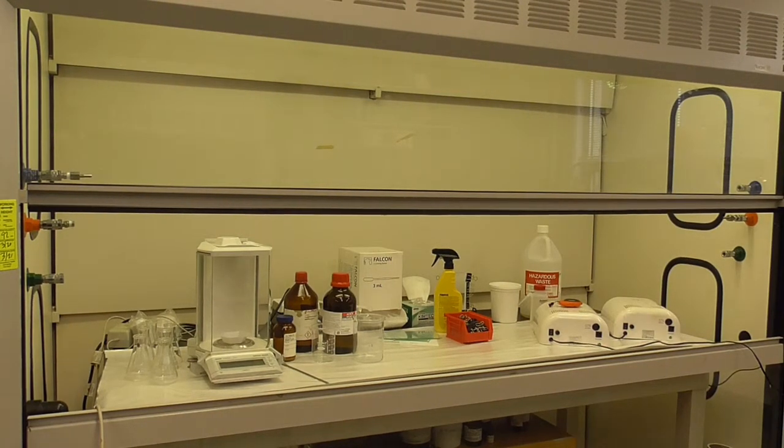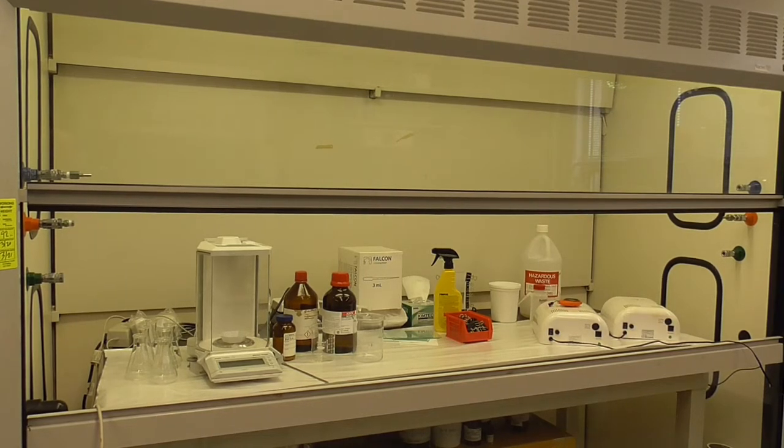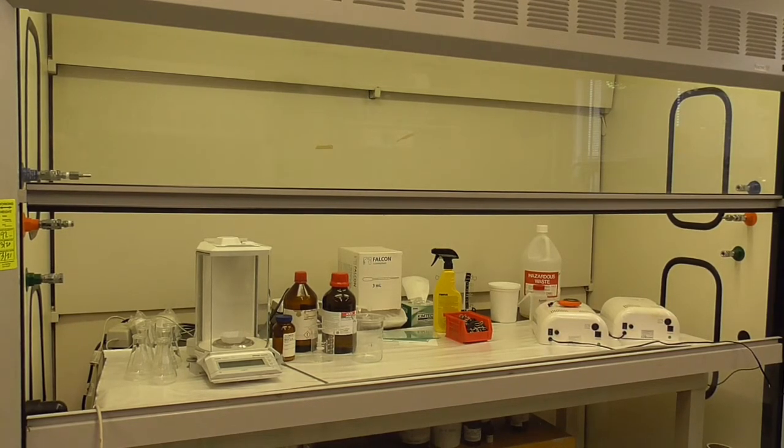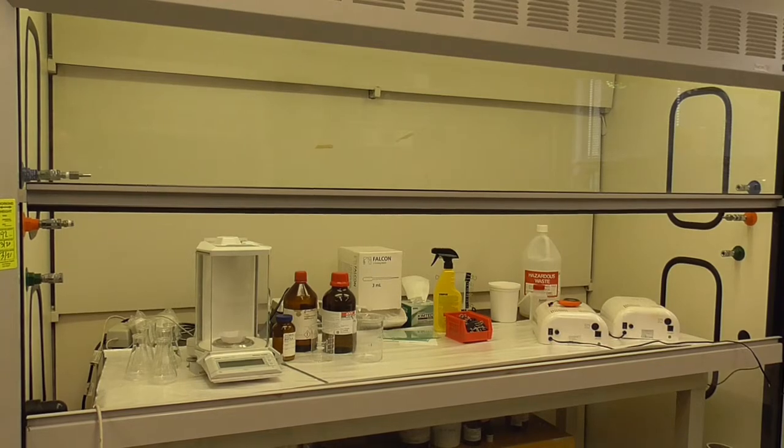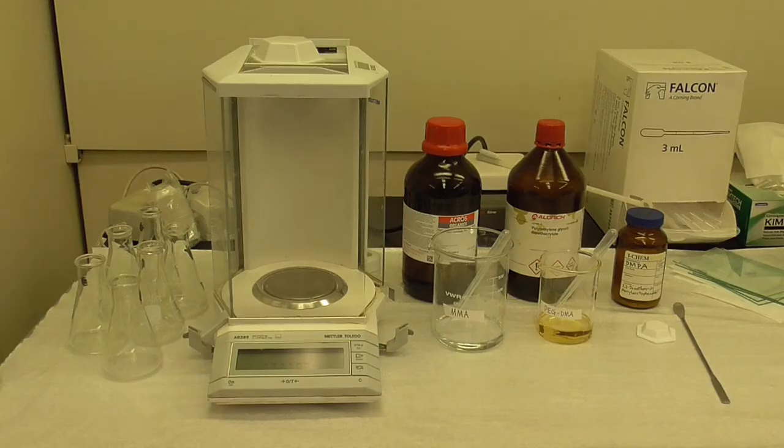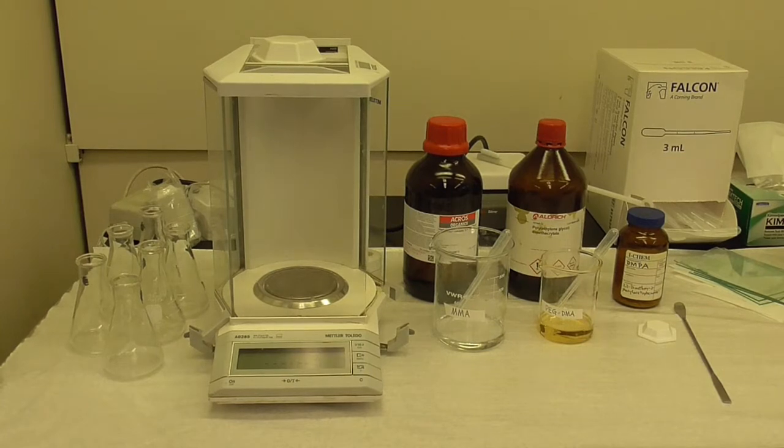Here you see the setup in the hood for synthesis of acrylic polymers or shape memory polymers. You start with a clean Erlenmeyer flask and tare that on the scale.